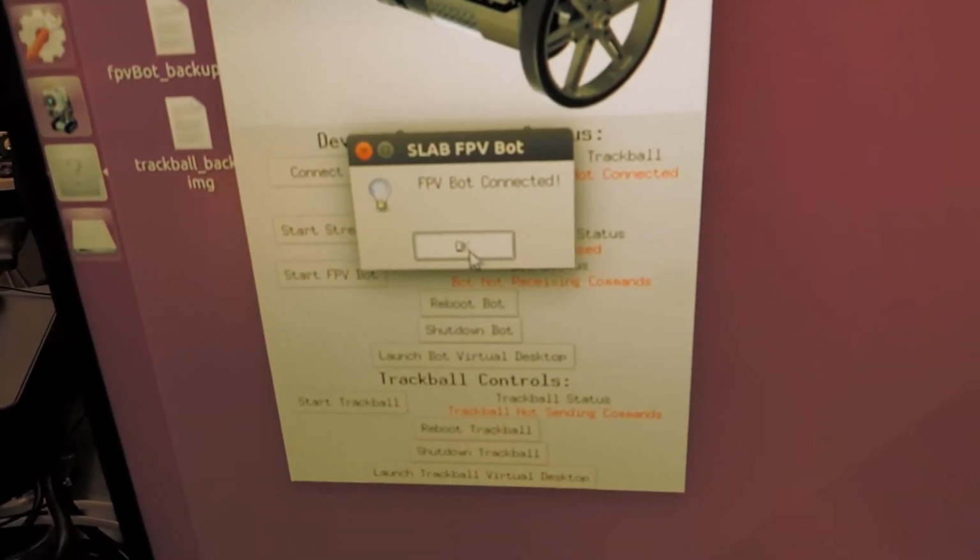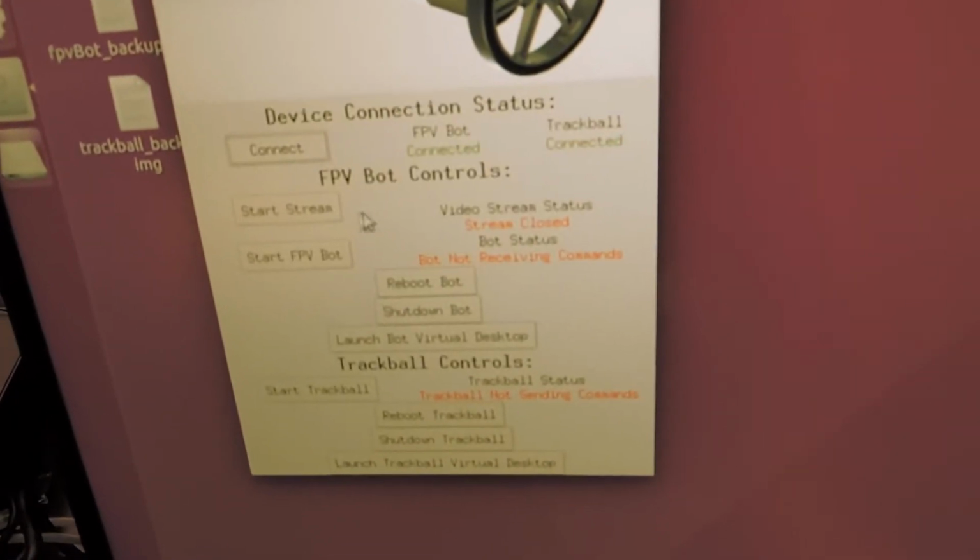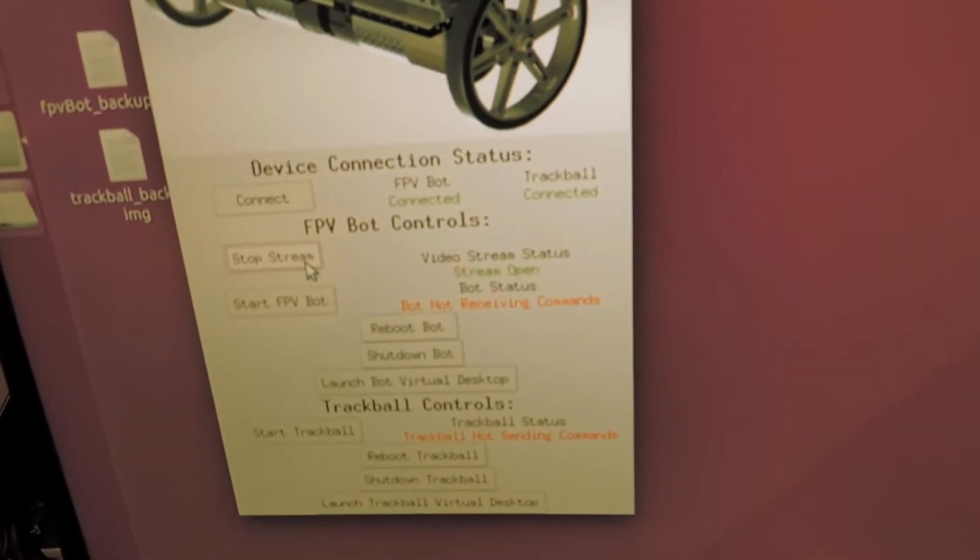so we'll just make sure everything's connected and on the network. We can start the video stream, and here you'll see it. There are a couple different resolution options, but right now we're going for lowest possible latency, so we're just doing 640 by 480.